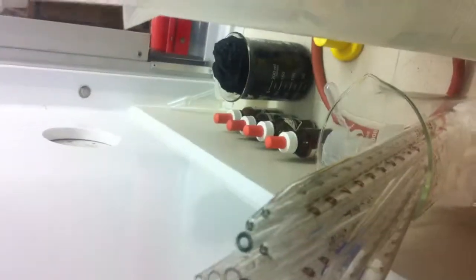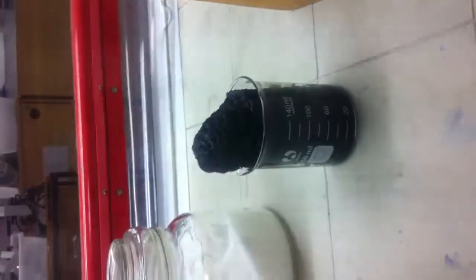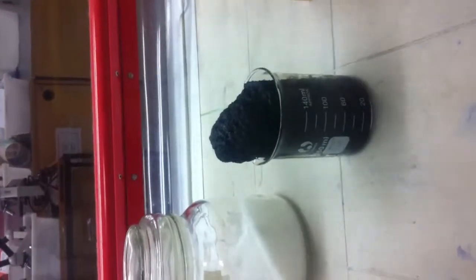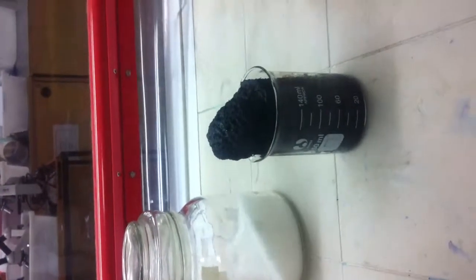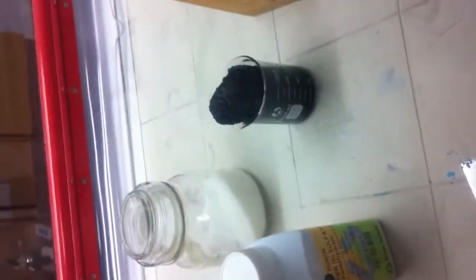If you can see, that is what that was. It dehydrated. So YouTube viewers and Miss S actually did it. That's solid. Guess what we're doing? Properties of sulfuric acid.